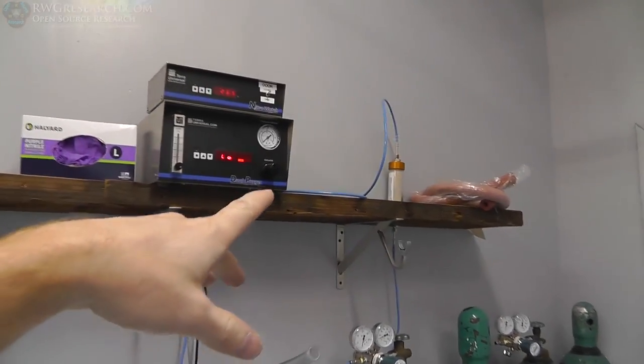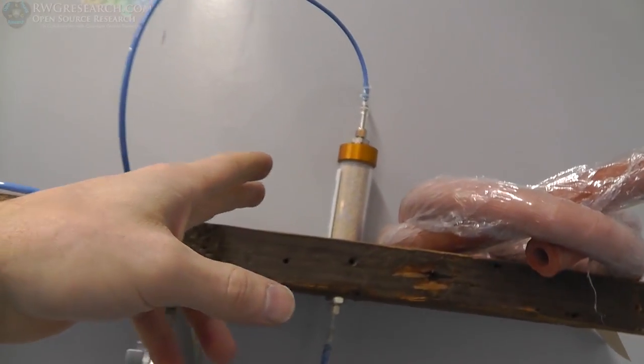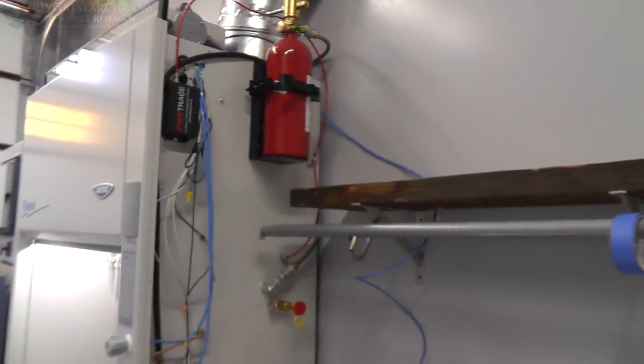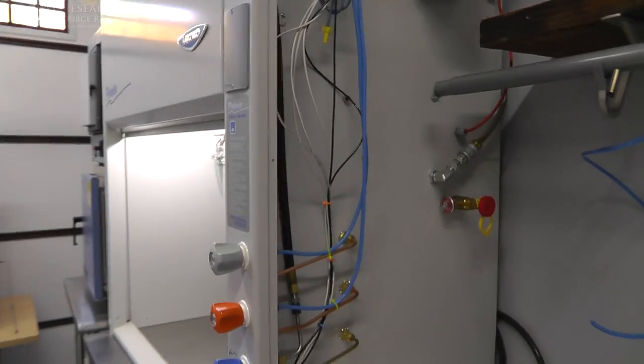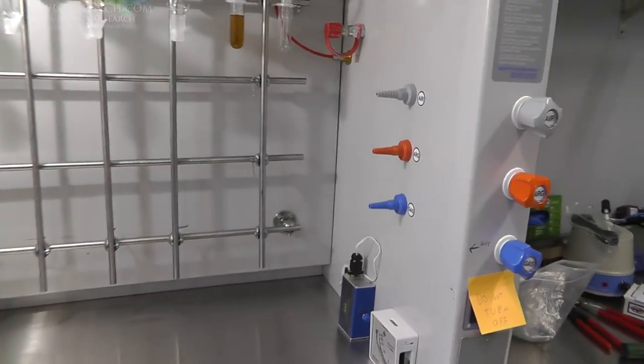So we've got an oxygen scrubber. No, actually that's a moisture scrubber. And then the oxygen scrubber is not here yet. We'll plumb it over to there. So I'll put this panel back on, but that looks really nice. I'm very pleasantly pleased with how this turned out so far.